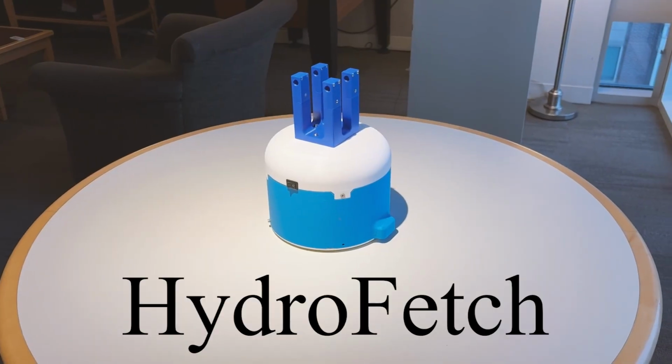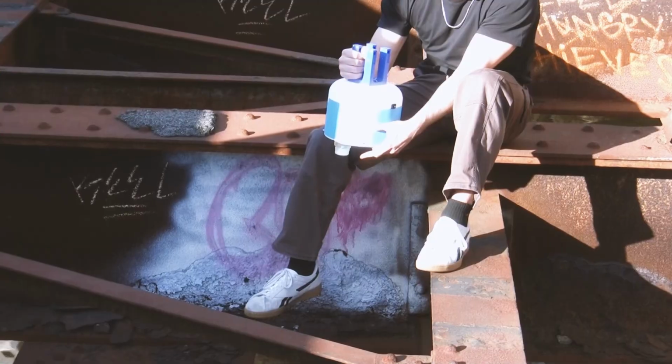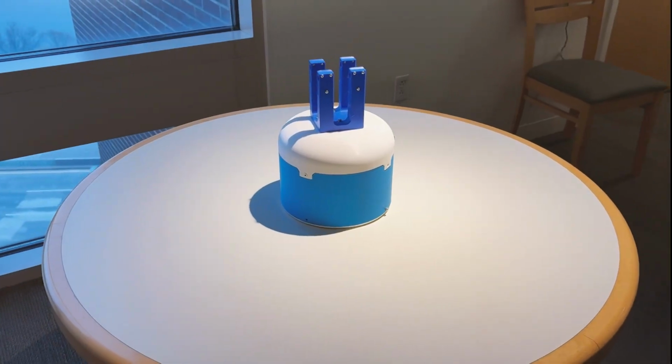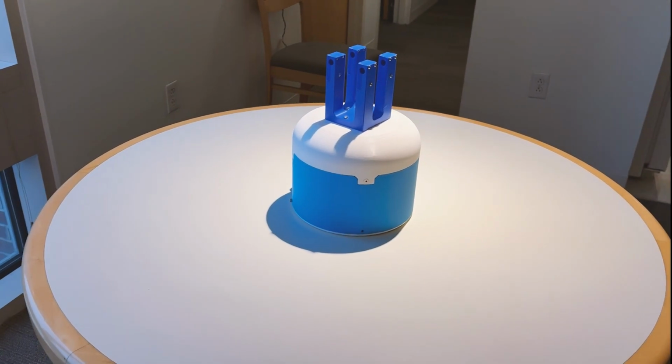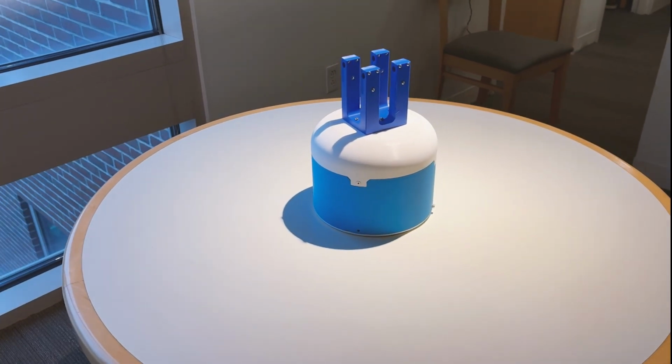This is HydroFetch. It's a device that's meant to collect water samples of remote bodies of water to facilitate the testing for water contaminants such as E. coli and PFAs. It attaches to a drone for remote sampling and has a mount that is modular and interchangeable to adapt to a variety of existing drones with its required payload capacity.